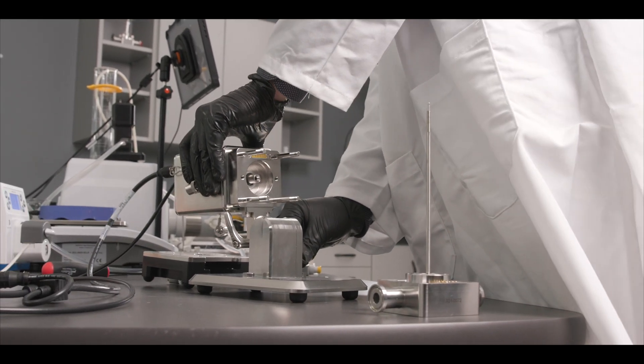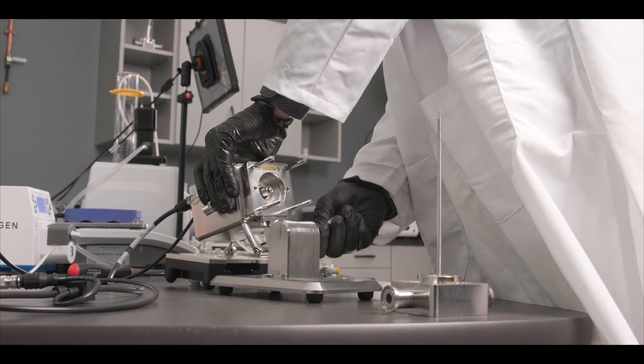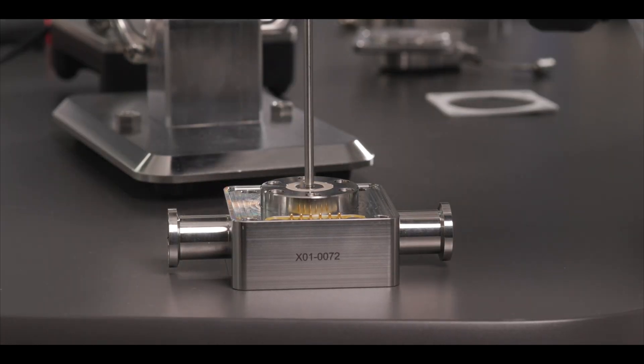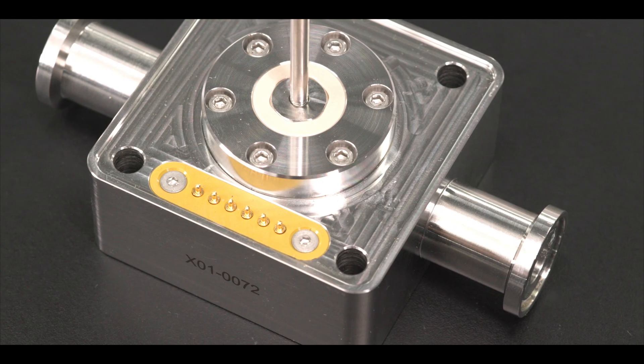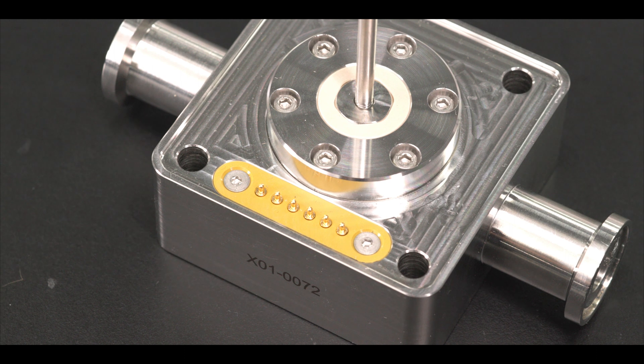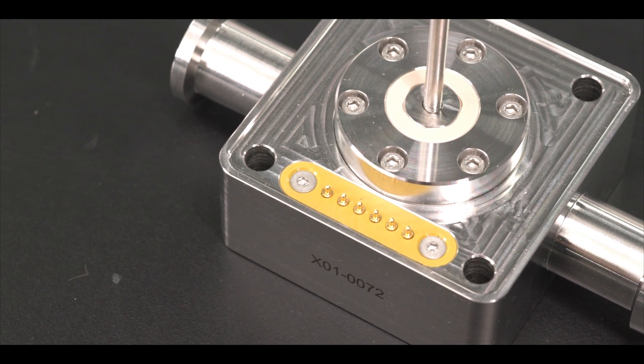Tilt the instrument back so the four alignment posts are facing you. Place a new flow cell gasket on top of the flow cell. Then insert the flow cell into the FlowVPX head. Make sure the flow cell smart pins are aligned with the flow smart input on the FlowVPX head.